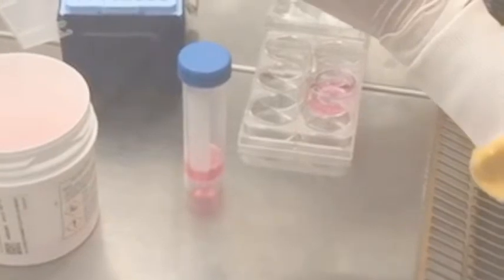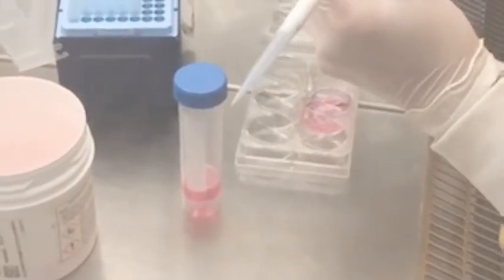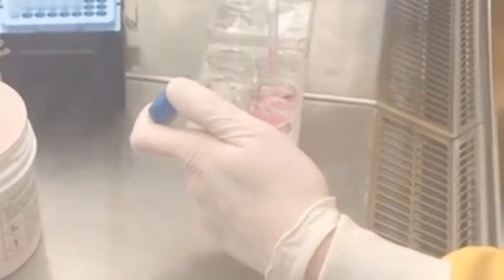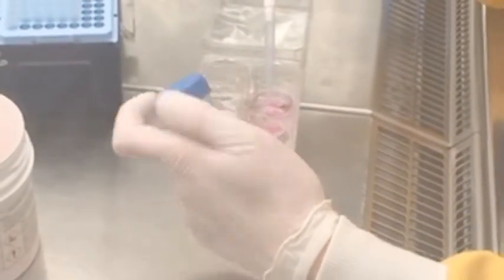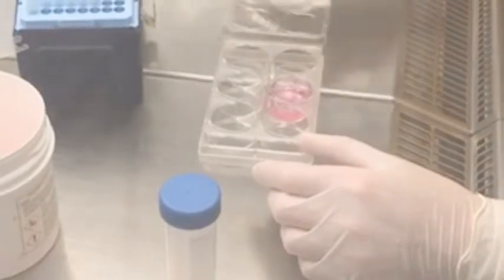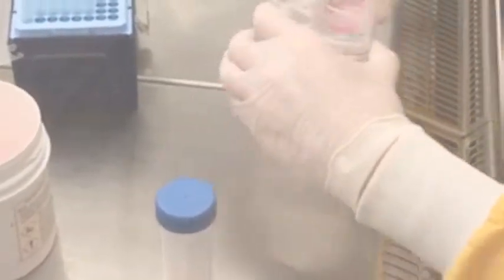Day 7 Seeding of Macrophage Cell Suspension. 50,000 macrophages are added per well. The plate is then replaced in the incubator for 90 minutes.